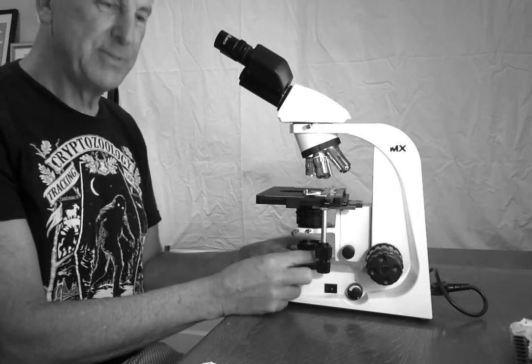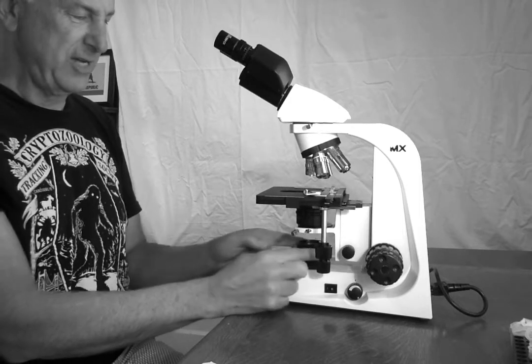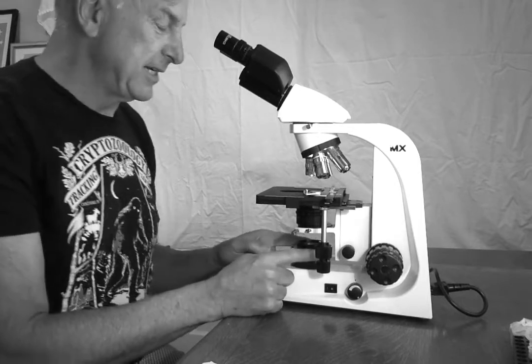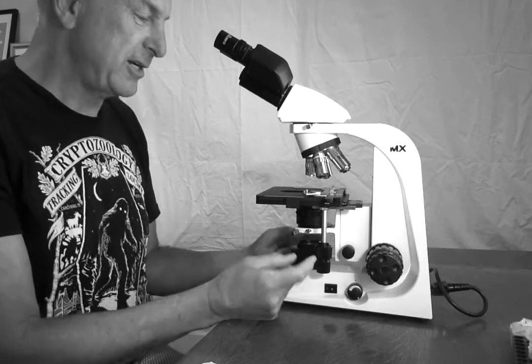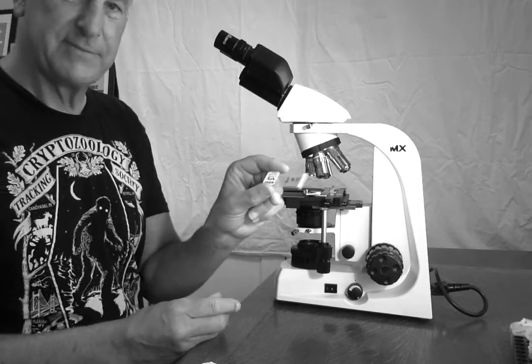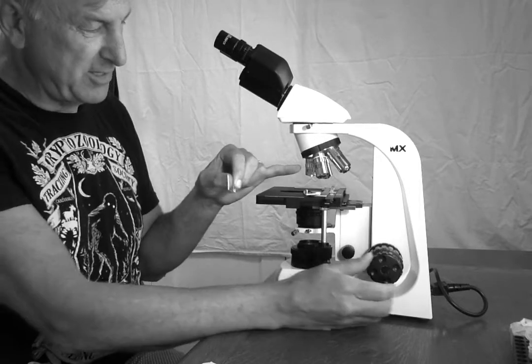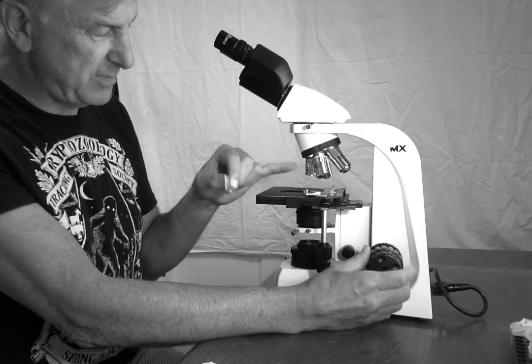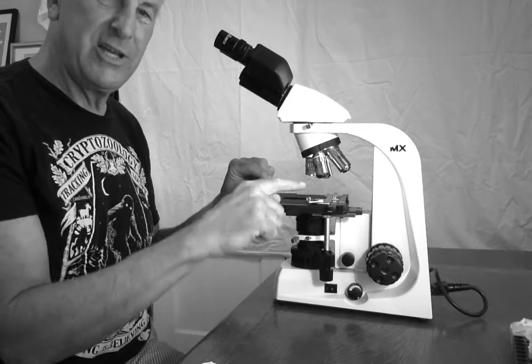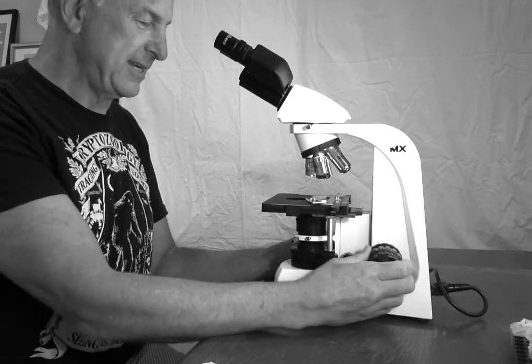Here is the lamp, and here is what's called the field diaphragm, which, kind of like on an old camera, lets more or less light through. Let's go through the process and identify the parts we need as we go. First of all, I'm going to get a slide with a sample already on it. I am going to make sure I'm on the lowest powered objective, the 4x. I'm going to lower my stage. I'm going to use these clips on the stage to hold my slide in place. And I'm going to raise it up a little.